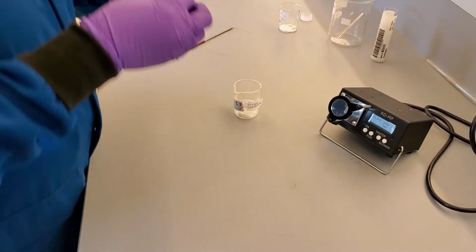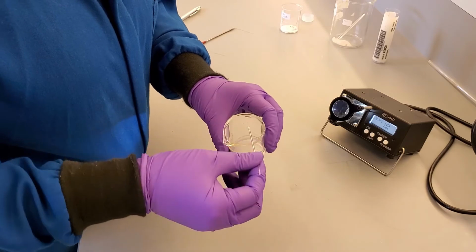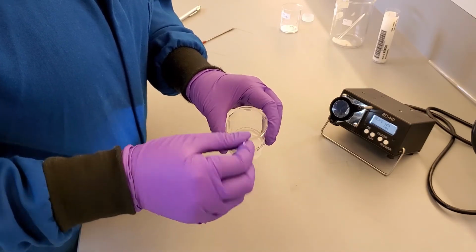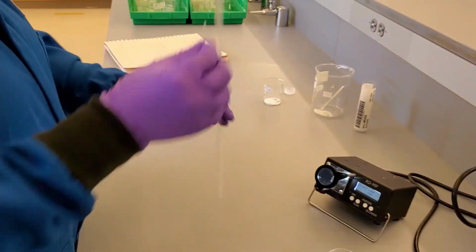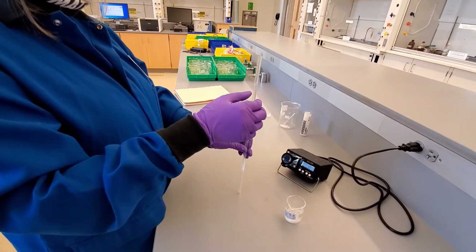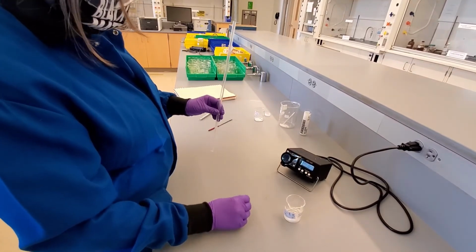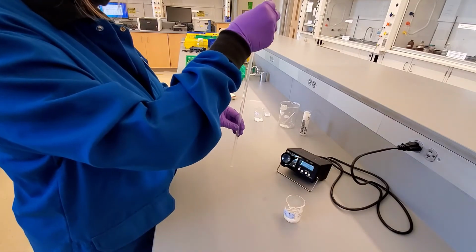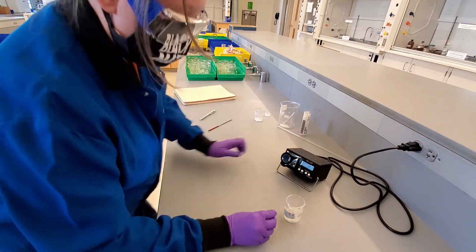We carefully obtain a new capillary tube and tap the crude naphthalene product with the open end until we have about 2 to 3 millimeters of product. Again, using gravity, we want to drop the capillary tube through the glass tube. However, the naphthalene is staticky, so it will not work. Instead, I firmly but carefully tap the capillary tube against the bench until it falls to the bottom of the capillary tube and is reasonably packed.